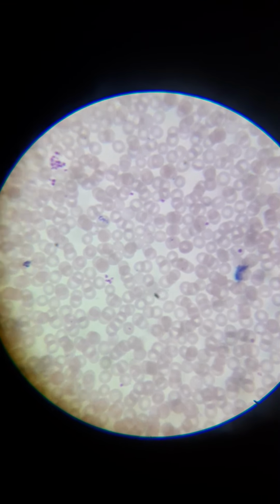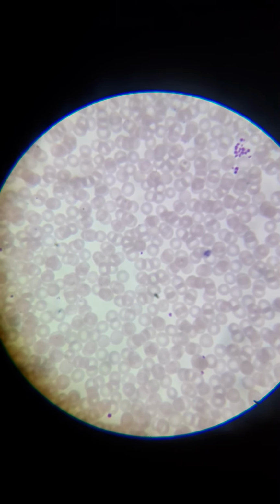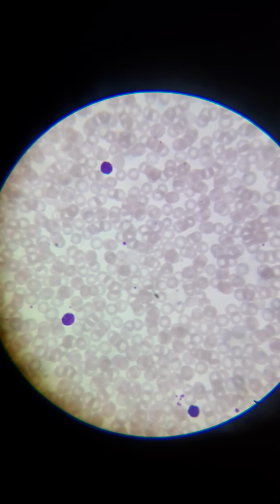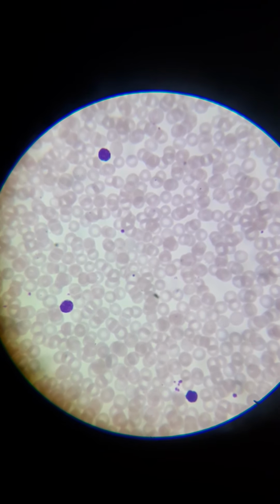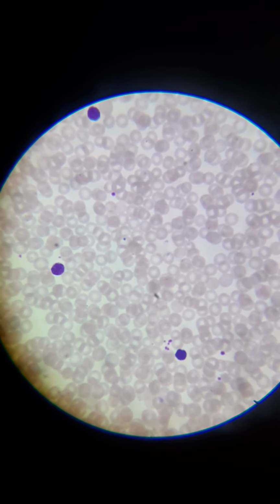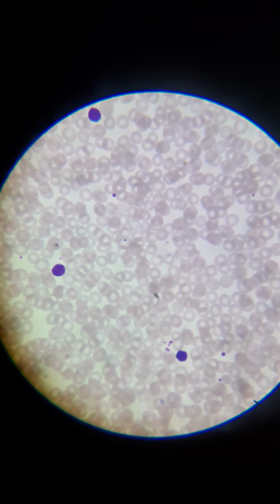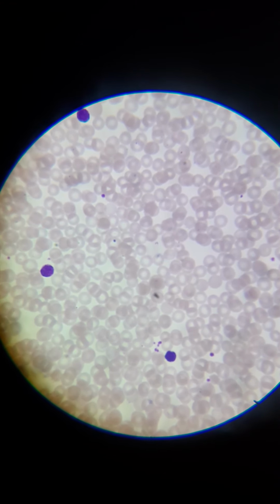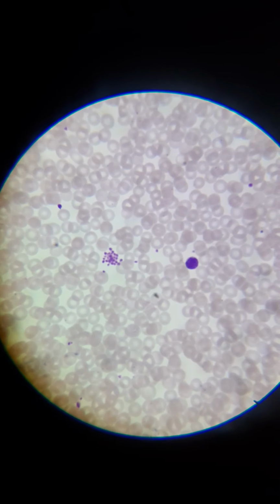Some of these red blood cells are a little bit different than the other ones. You might see where a few of them just look a bit bigger, a bit puffier. It's hard to make out, and it's hard to say exactly if they are, but those ones are what we call reticulocytes. Those are red blood cells that have just entered circulation and are not fully ready. They stay in the blood for anywhere from 24 to 48 hours before they mature into a complete red blood cell.